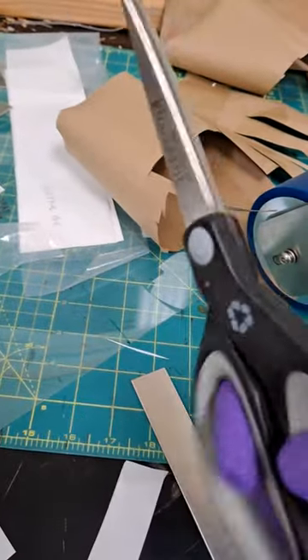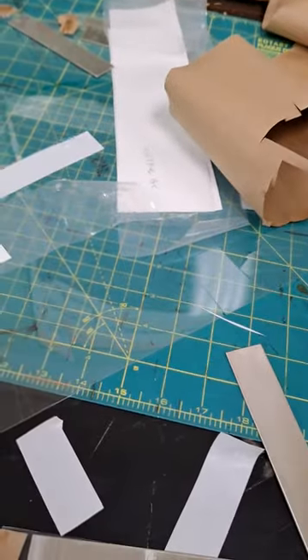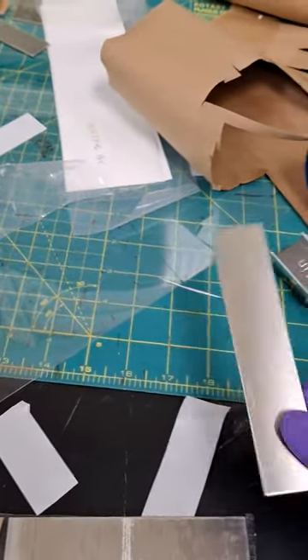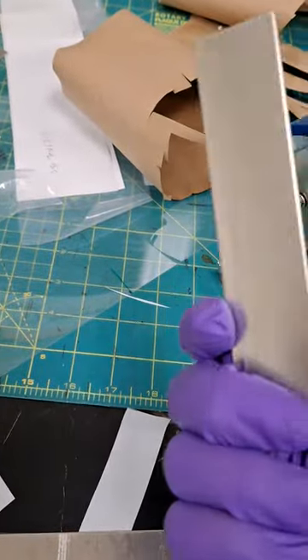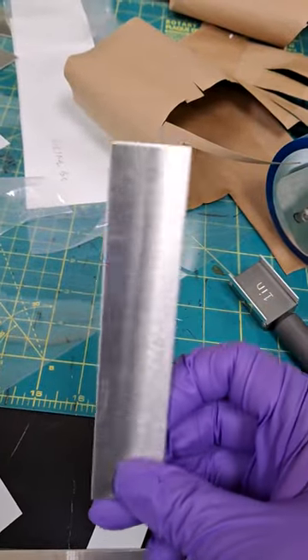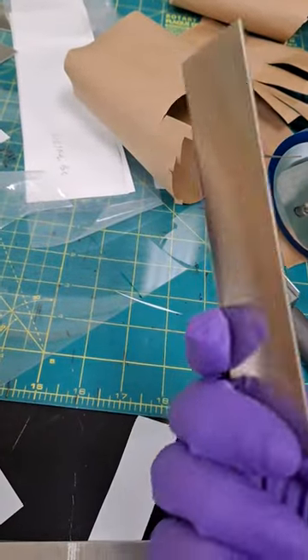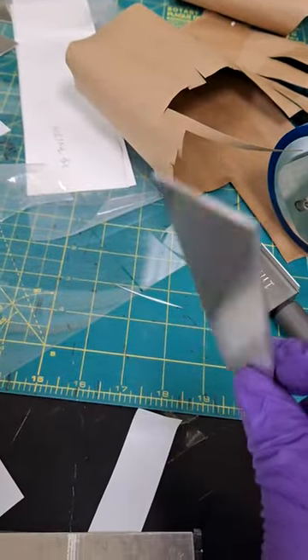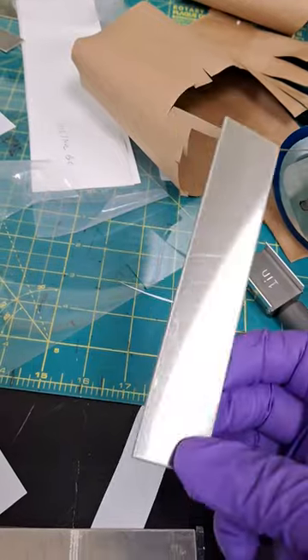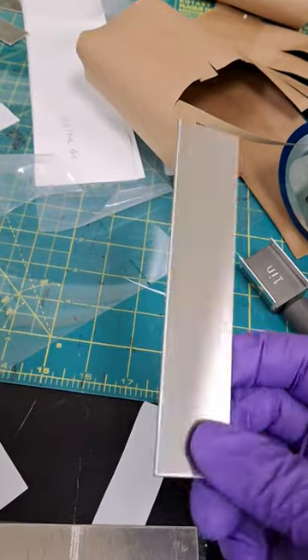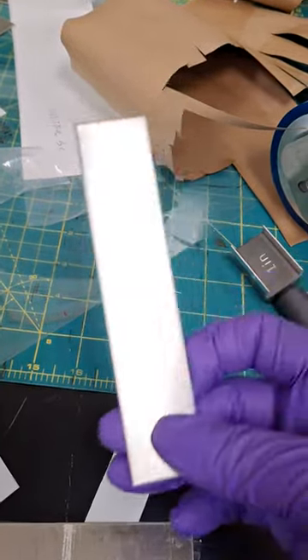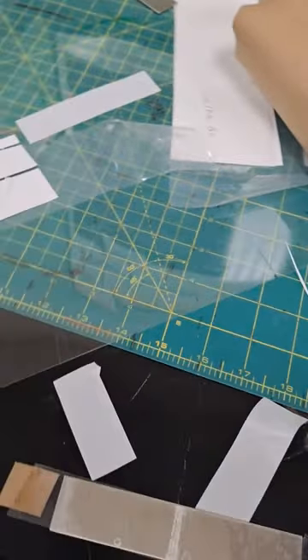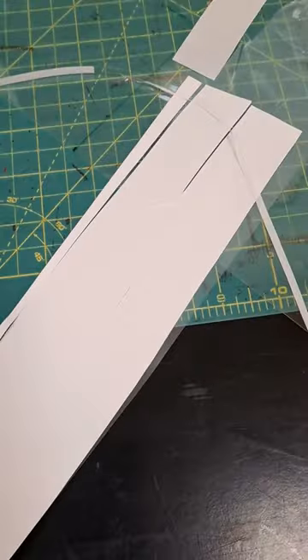Scissors, standard steel plate that is 5 inches by 1 inch, and this is the tape.